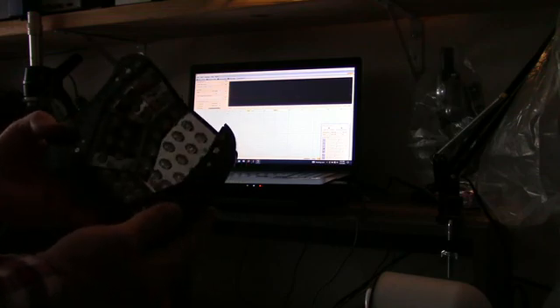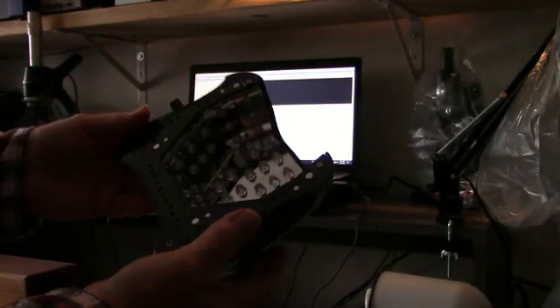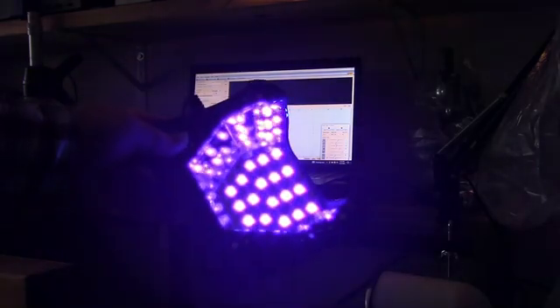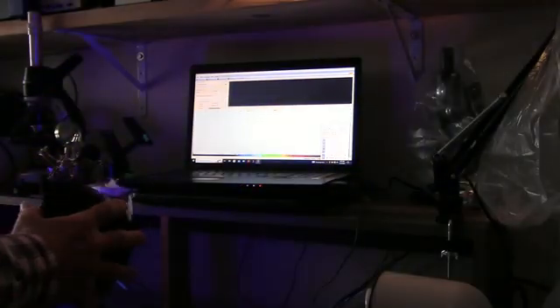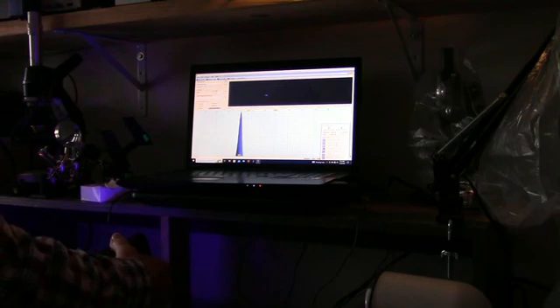Next, I'm going to try this device, which I picked up at a thrift shop. I think it is used with cosmetics of some type. I'm going to use it to erase EEPROMs. But anyway, these are UV diodes, LEDs. Let's see here. Okay, here are the spectral lines of those, and it looks like about 410 nanometers. So you can see the difference there.